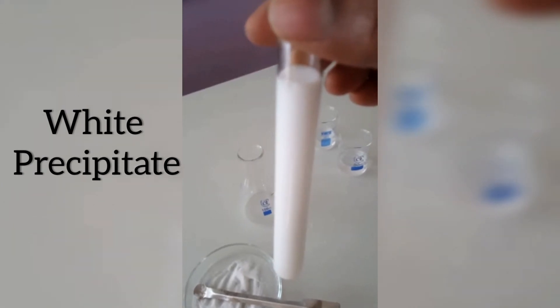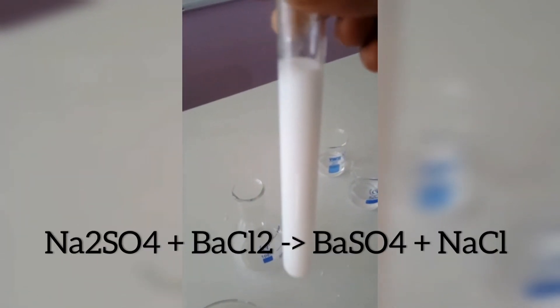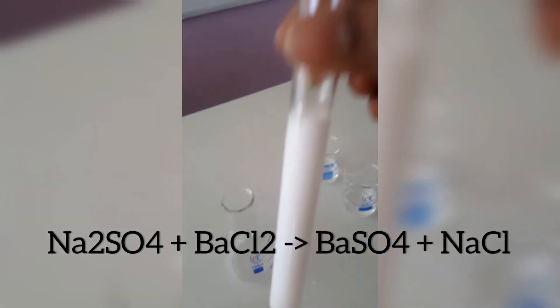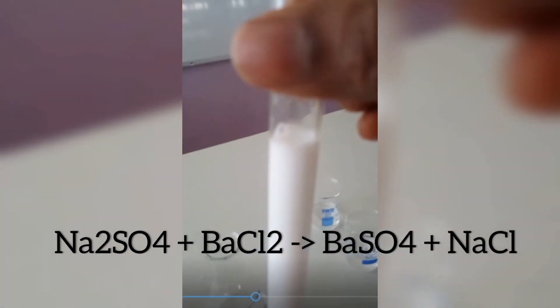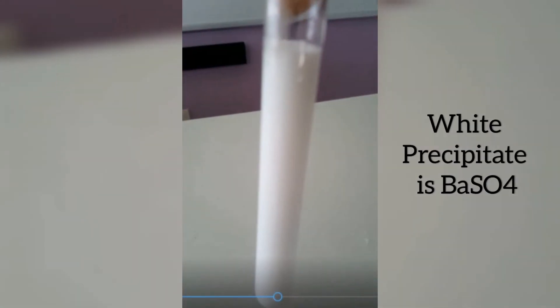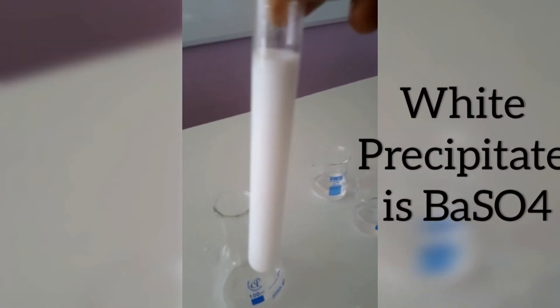A precipitate is a solid residue formed in the reaction. In this reaction between sodium sulfate and barium chloride, barium sulfate and sodium chloride are formed. As you know, sodium chloride is soluble in water, but the white color precipitate is barium sulfate. So barium sulfate is the major product and it is formed as a precipitate. This white color substance is barium sulfate precipitation.